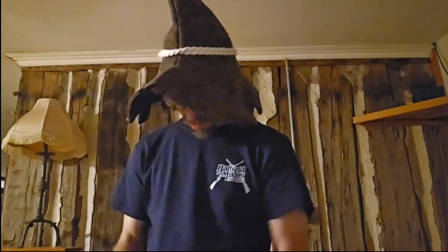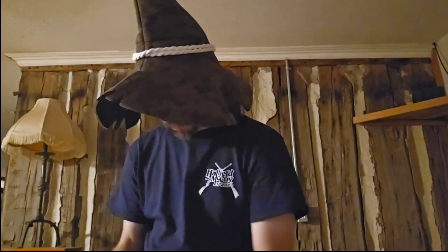So I'm going to get my gloves on. We've got to be safe about this stuff, right? I'm going to try and show you guys. I'm going to see if I can tilt this.